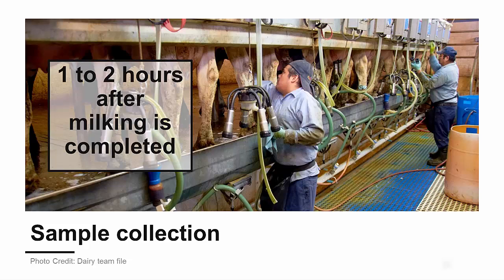Now let's discuss the process of collecting a milk sample. The best time to collect a sample is one to two hours after milking. The recommendation is to take the sample when the milk in the tank represents only one milking.